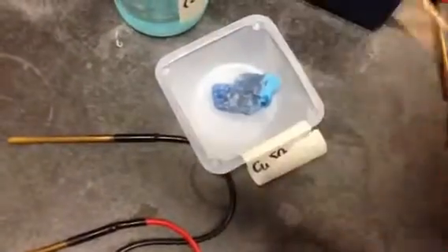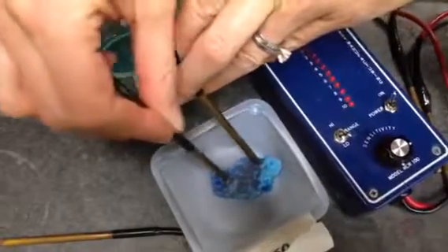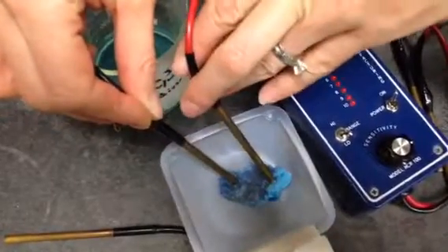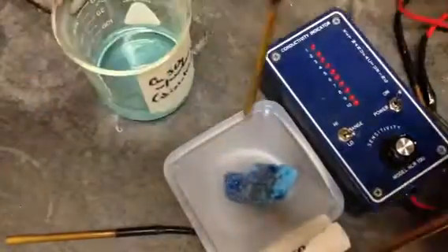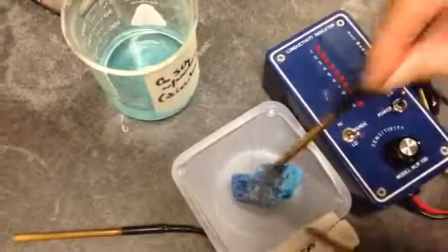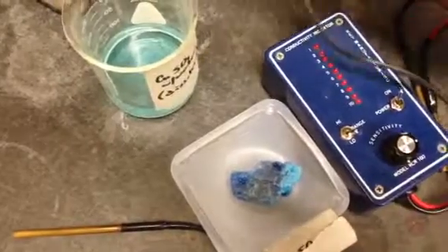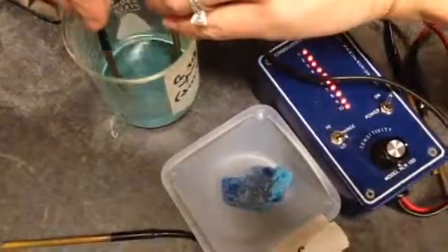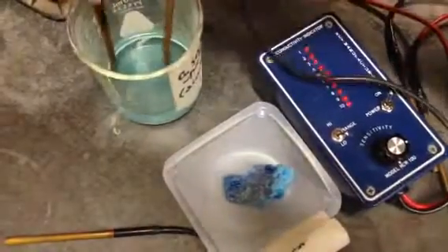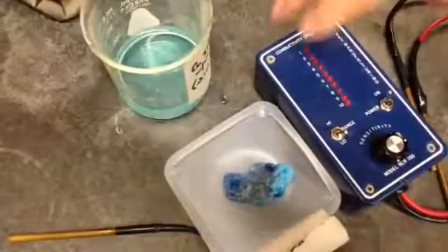Moving down here, we've got copper sulfate as a solid and dissolved. I'm going to measure it first as a solid. Get this closer. Nothing. Okay, so 0 conductivity for the copper sulfate as a solid. Now this very same chunk was put into water here to dissolve, so copper sulfate is capable of dissolving. Here's a dissolved sample. Notice all 10 lights are lighting up for the dissolved copper sulfate. So mark that down, 10 for the conductivity for copper sulfate.